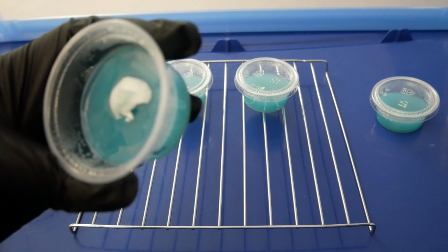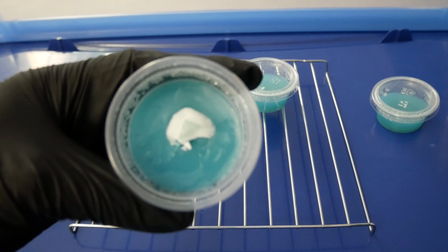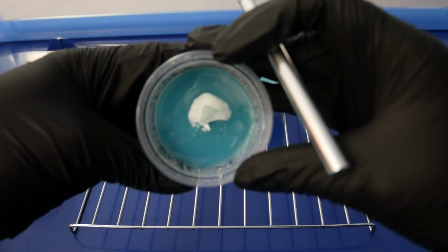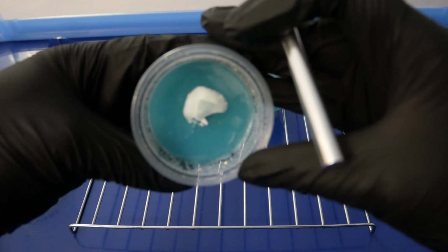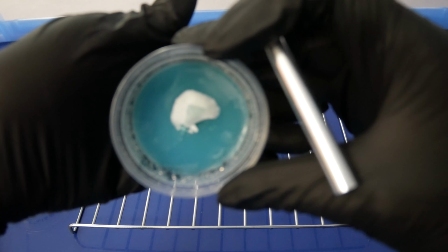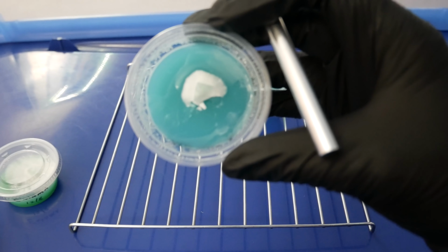Here I'll give you guys a good look at the goopy dish. As you can see, the mycelium is growing, but it's surrounded by some bacterial growth, some slime looking stuff. Not good. So you want to make transfers out of it pretty early. I'll try to bring it closer to the camera so you guys can see. Hang on here.